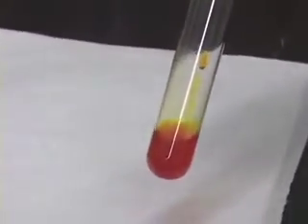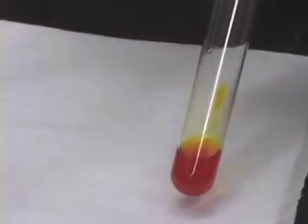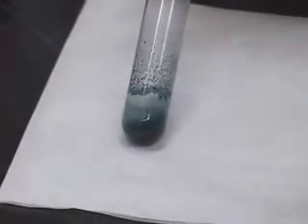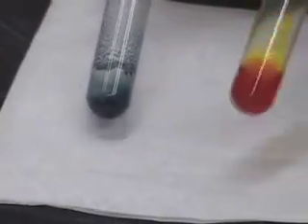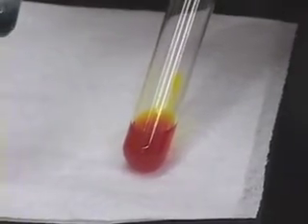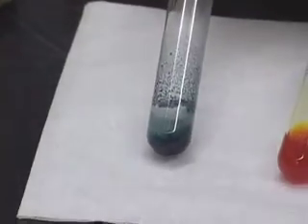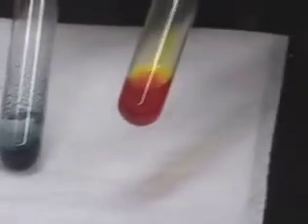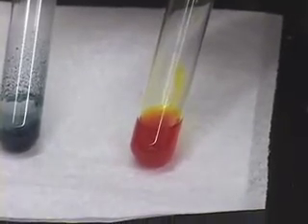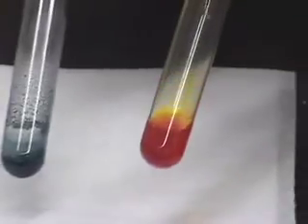Let us compare the test results we got for 1-butanol, which is a primary alcohol, to that of T-butanol, which is a tertiary alcohol. 1-butanol gets oxidized and we get a blue-green precipitate of chromic ion — a positive test result. T-butanol does not react and we get a yellow-orange solution — a negative test result. This is how the chromic acid test is done.